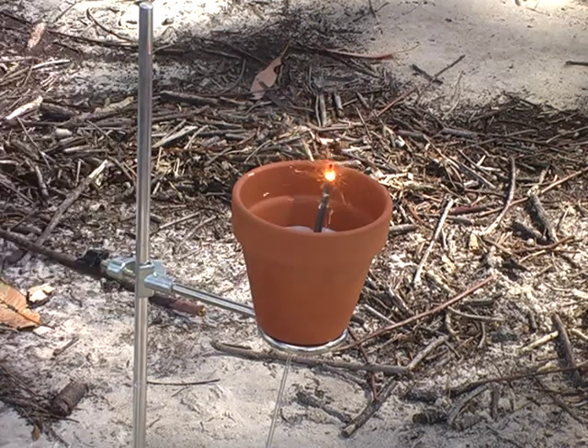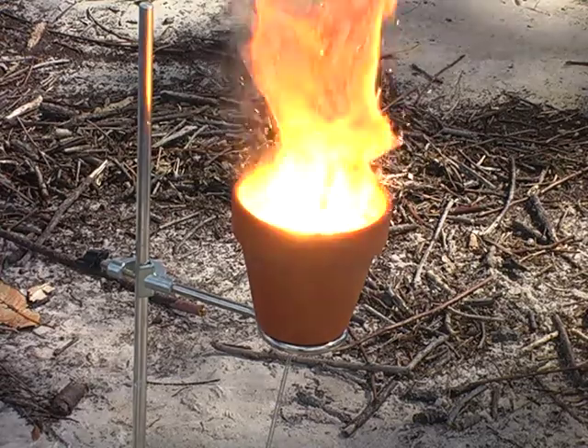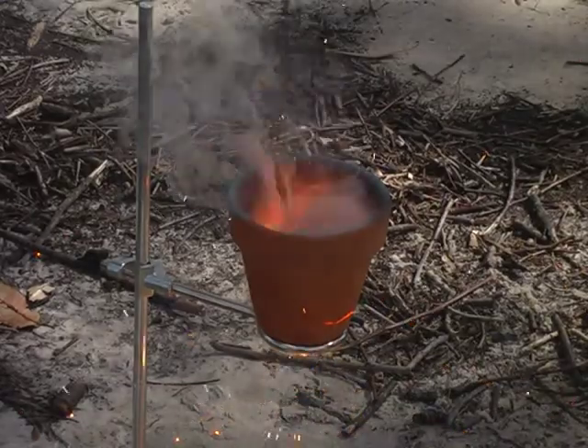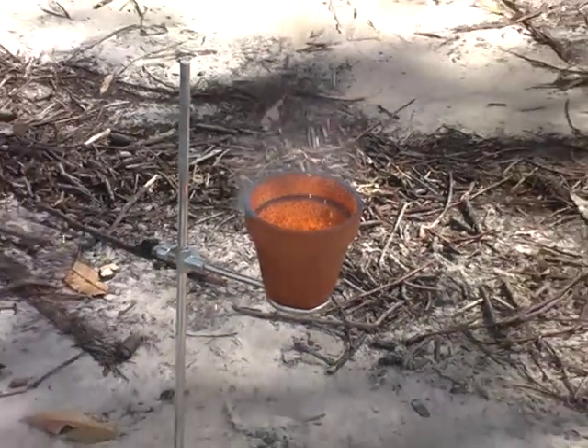Right, we're on. We have a go ahead. We have a go. Stand back. Oh, it's gone, it's cracked. It's gone. Hence the sand, ladies and gentlemen. Hence the sand.